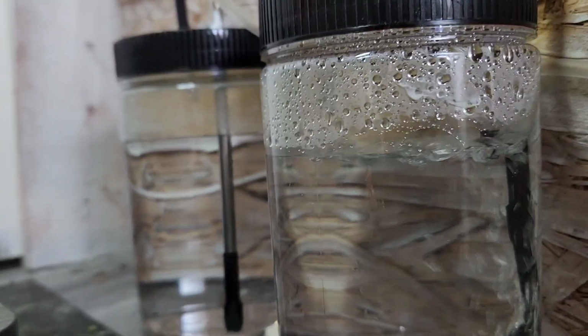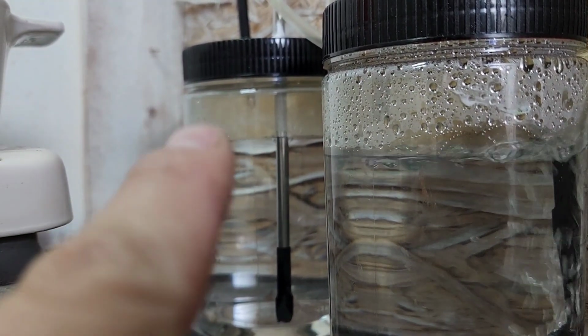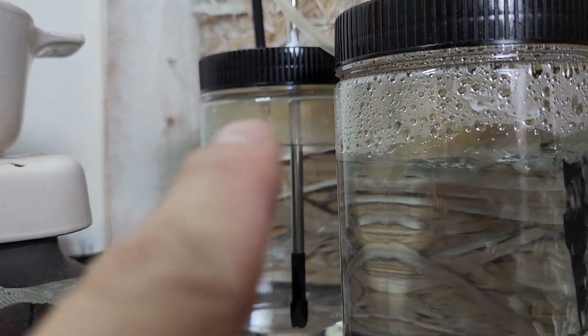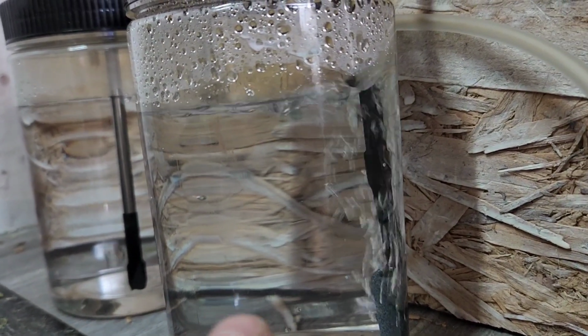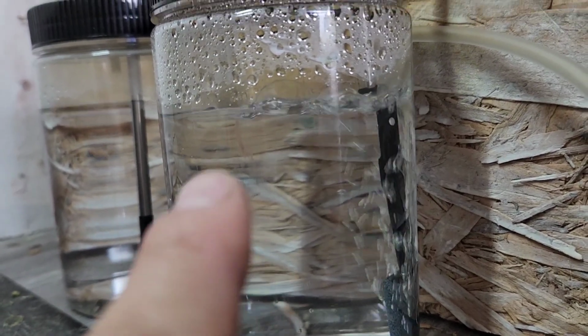You can see we have a very light coloring of nitric there. So we know that it's slowly going over that way. I just know there aren't good seals on these things. So this is going to be working properly, well, to the best of my ability, or of its ability.